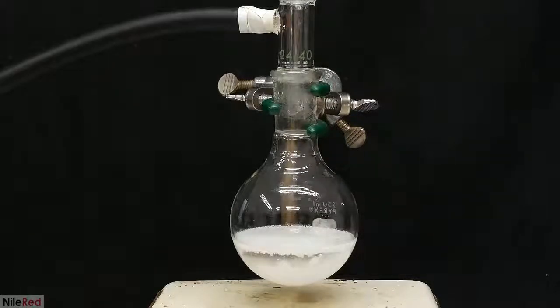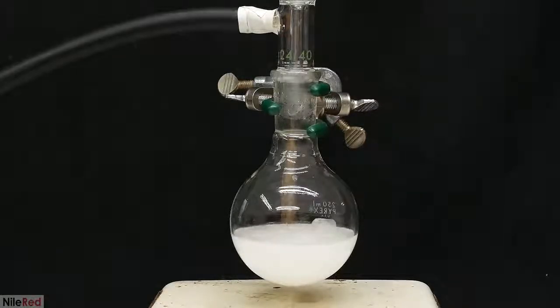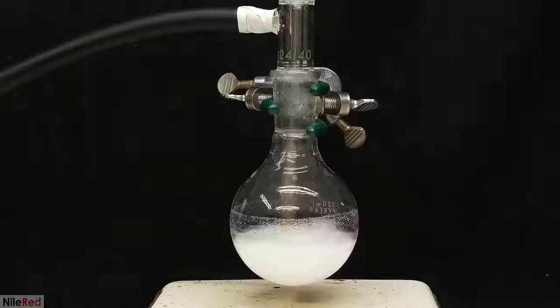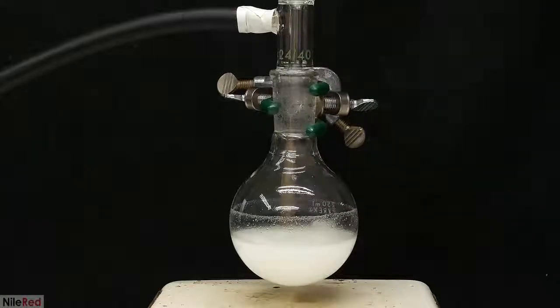When I was ready to get things started, I turned on the magnetic stirring. Most of the adipic acid is not going to dissolve, and this is perfectly fine. I open the addition funnel, and the oxalyl chloride is added over the course of about 5 minutes. My dichloromethane and adipic acid aren't perfectly dry, so there's a little bit of water present. The first little bit of oxalyl chloride that's added is going to react with the water, and it can sometimes be pretty vigorous. It's highly unlikely that it would ever cause it to bubble out of the flask, but it's just a good precaution to take.